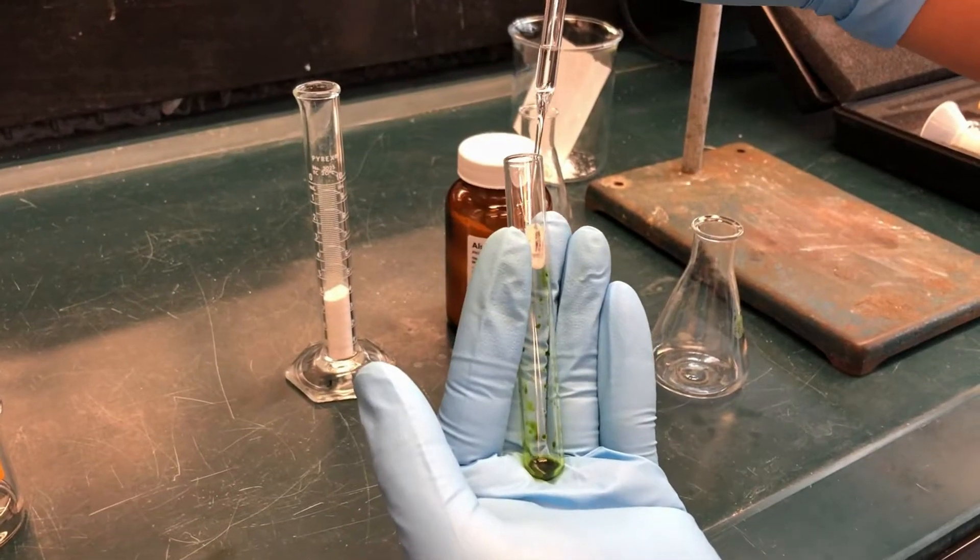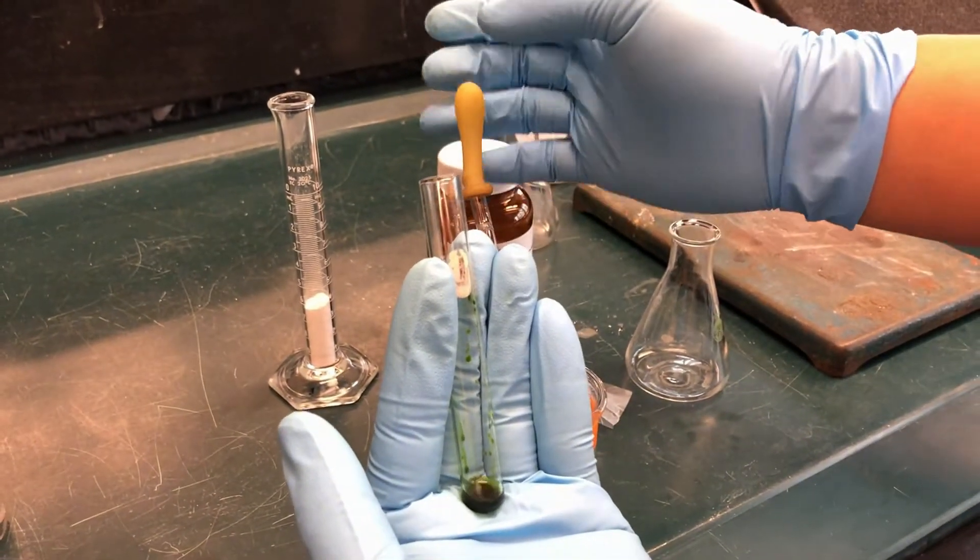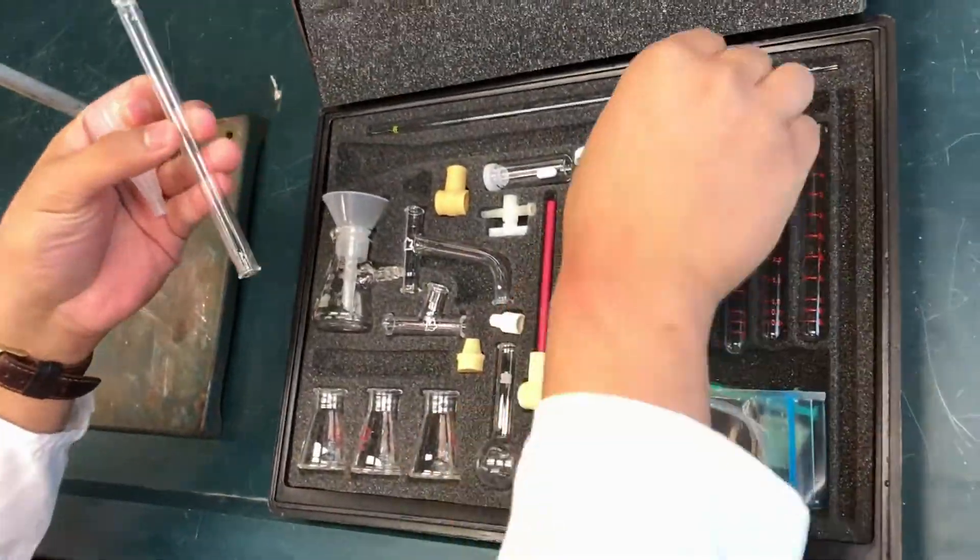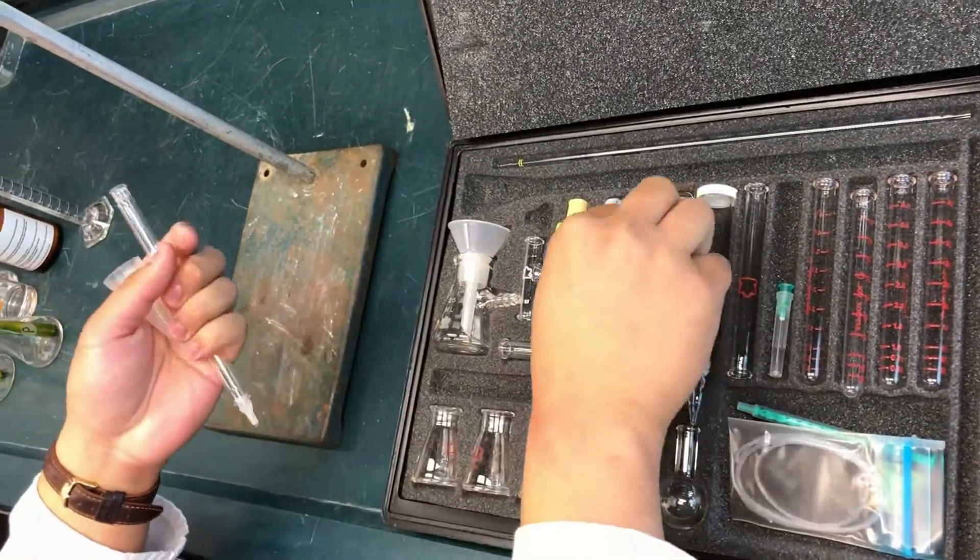You will need to rehydrate your pigment using about 0.5 mL of petroleum ether. Prepare the column using a funnel, chromatography column, and stopcock from the Microscale Kit.